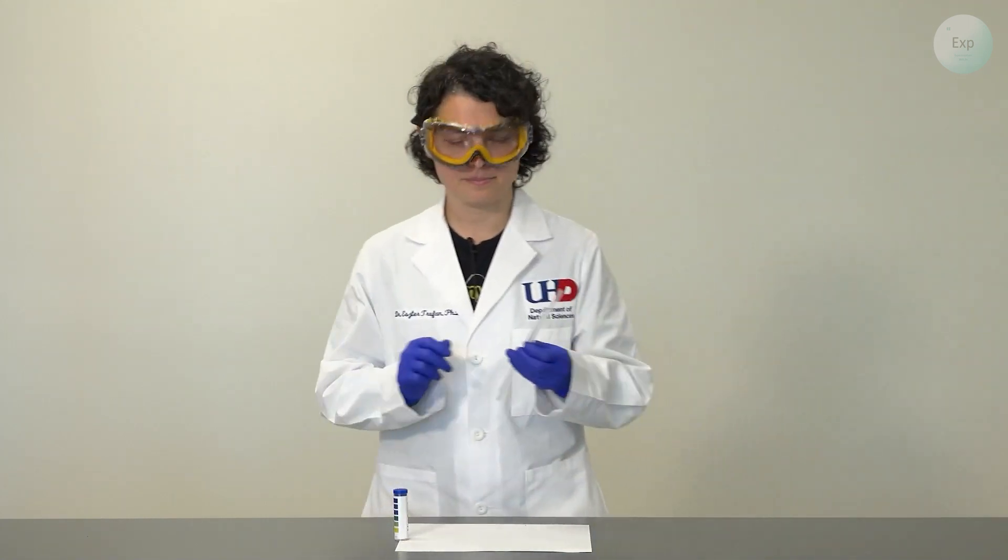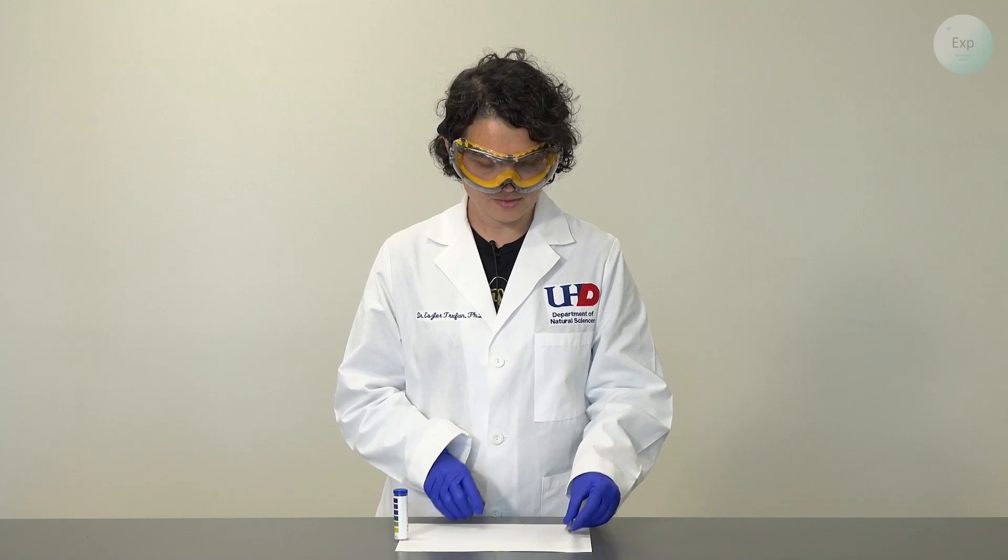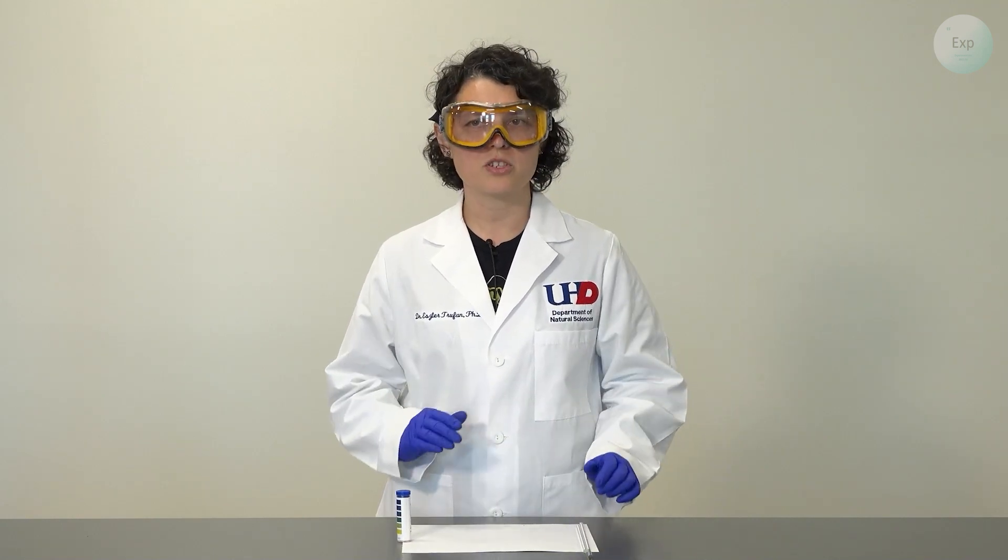For the measurements we're going to use some glass stir rods and you can use just one but just be mindful that you will have to clean it and dry it between samples.